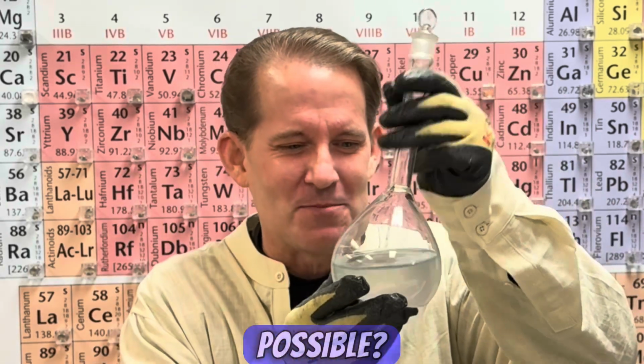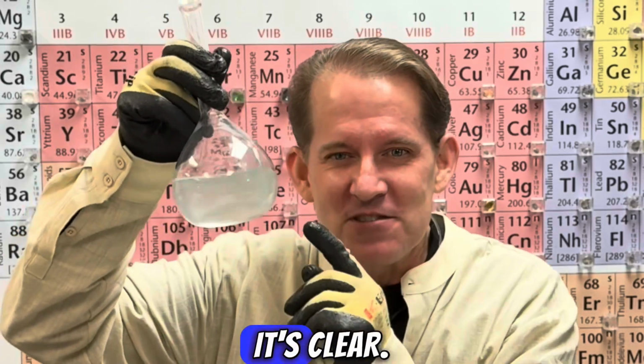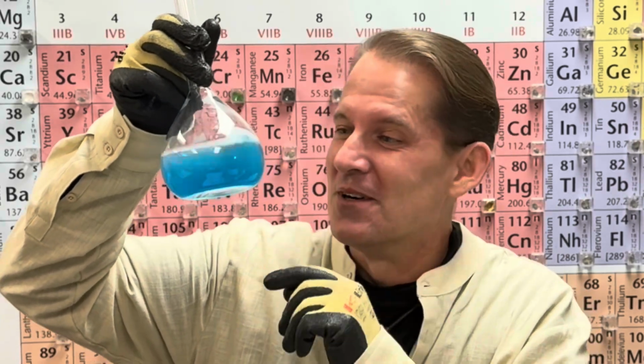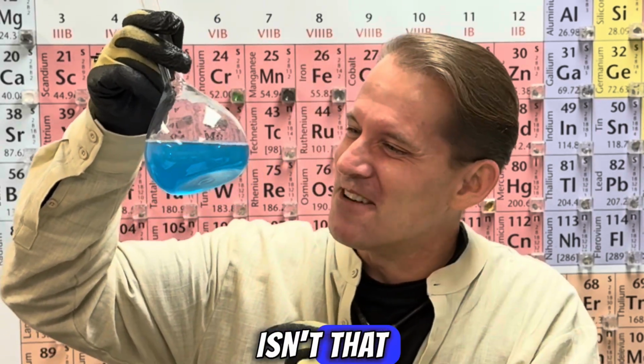How is that possible? I'll do it again. Right now it's clear. I'm gonna shake it up, and it turns blue. Just look at that, isn't that amazing?